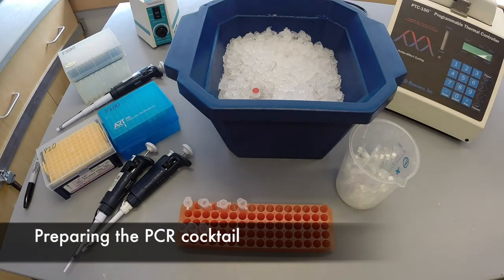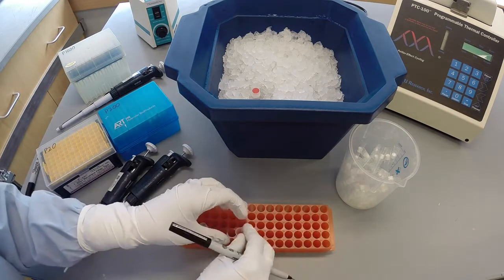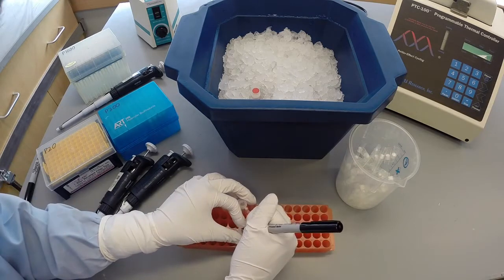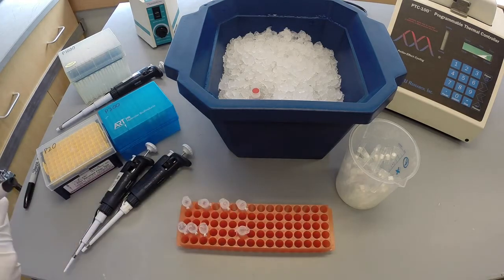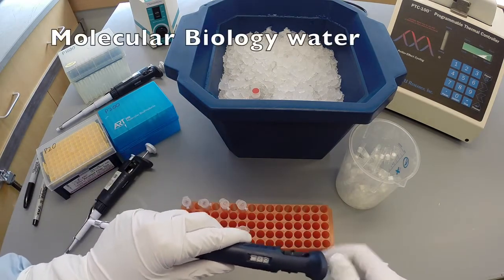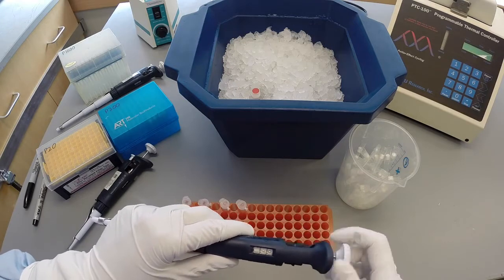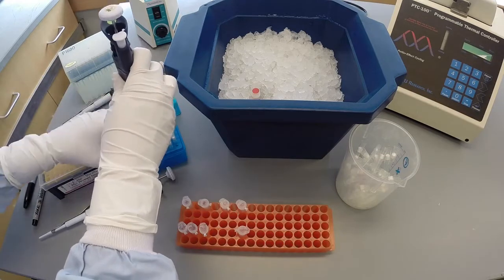Next, prepare the cocktail by using the volumes and reagents indicated on the worksheet. Obtain a new tube and label it as the cocktail. When creating a cocktail, it is best to start with the largest volumes. Though RedTaq is the largest volume, the solution should be kept on ice as long as possible, so instead the water is added first. When adding each of the reagents, be sure to use the appropriate micropipetter for the volume being added.